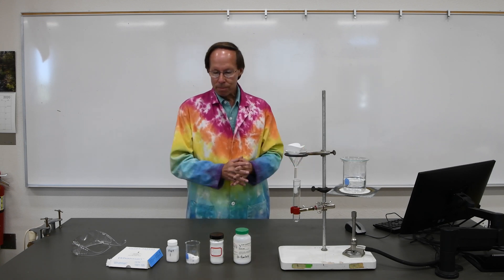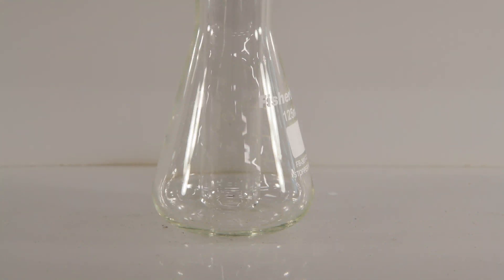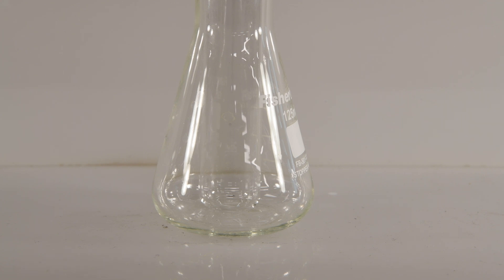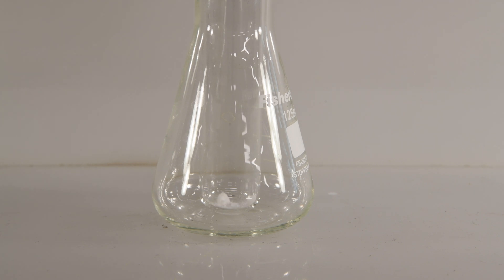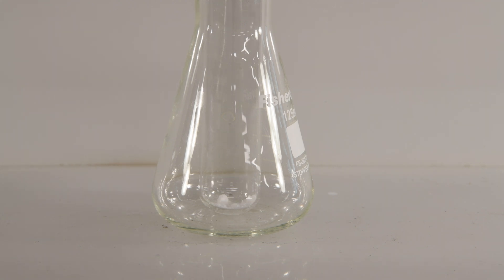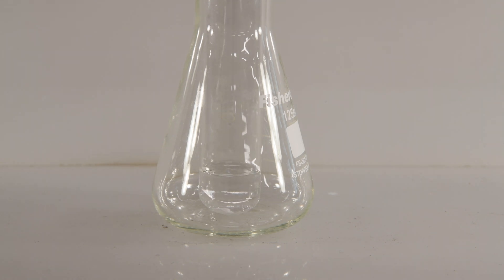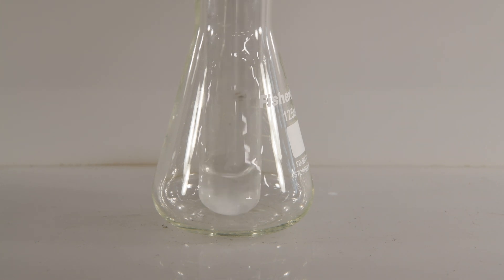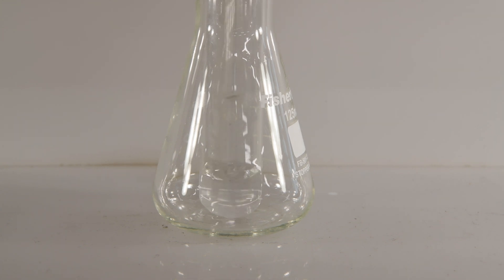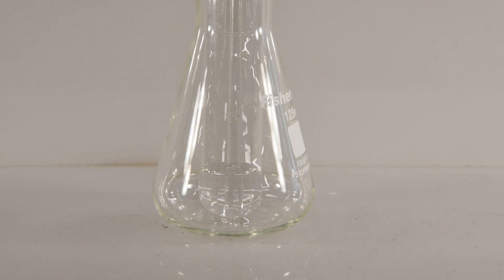That's the basic setup of the lab. Let's head over and begin testing our various substances. Our first solubility test will be salicylic acid and ethanol. We'll put a little bit of salicylic acid in a test tube and add some alcohol, then stir that to make sure. It appears that it is indeed dissolving, so we can conclude that salicylic acid is soluble in ethanol.